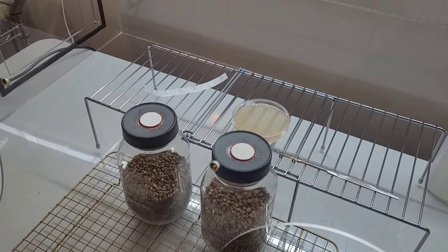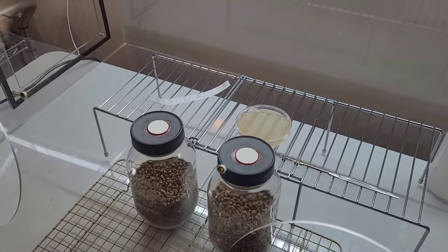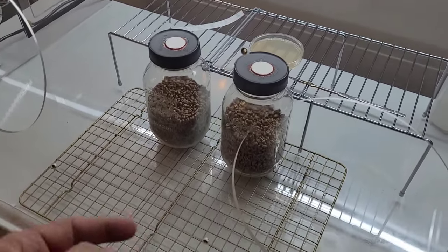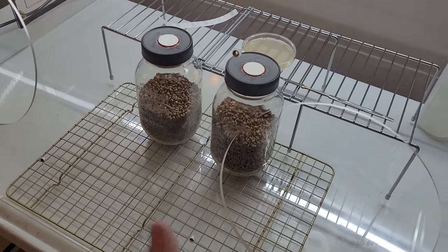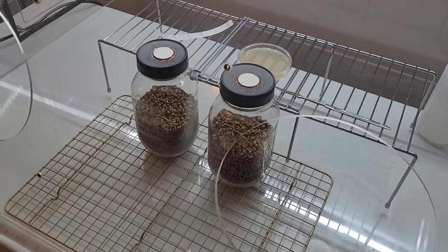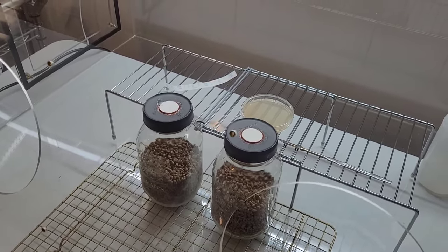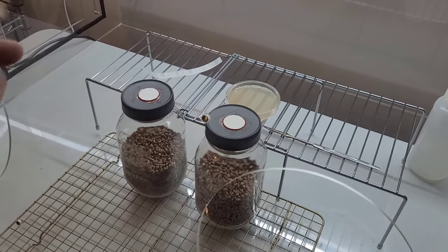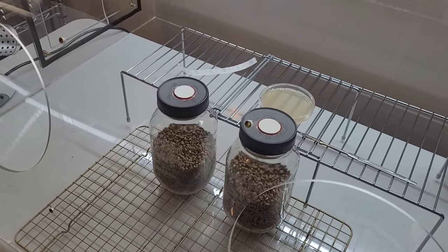Whether the incoming air is filtered or not, what you are doing is creating turbulence which will kick up anything that is invisible laying on the floors or walls, ceilings, etc. of your still air box and keep them aloft, floating and rotating within your still air box, which gives it a greater chance of finding its way into your sterile work.